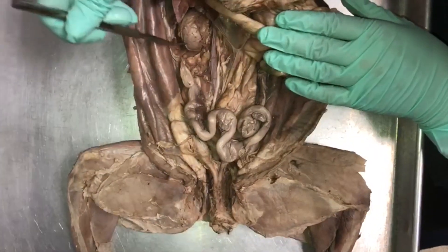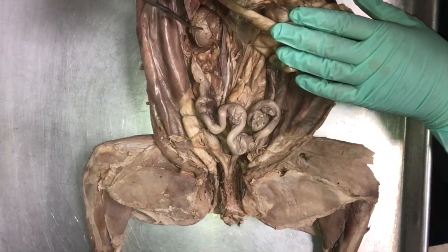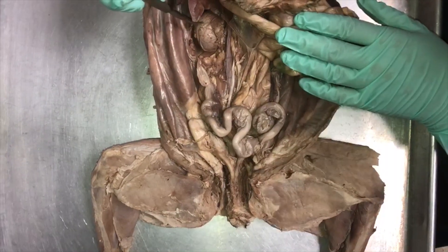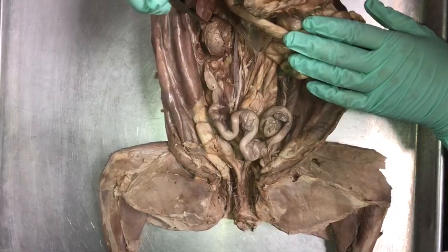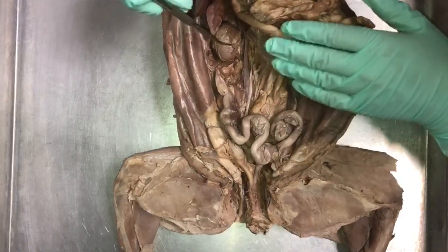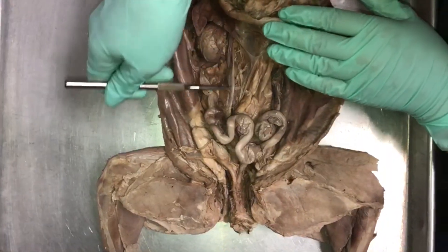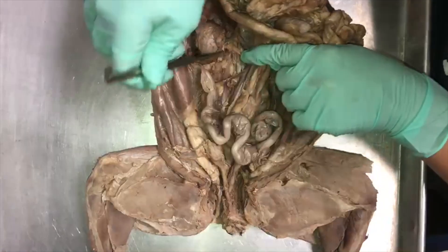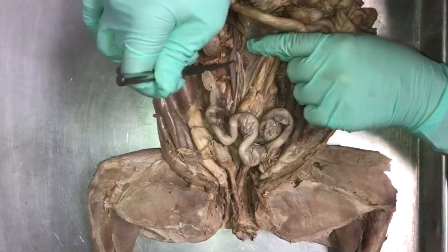Over here, you're going to have this round structure, which is going to be known as your kidney. Usually on top of the kidney, you're going to have glands known as your adrenal glands. But on this cat, they've been dissected out, so you're unable to see them. Going down from the kidney, you're going to have this cord here, which you can see is coming out of the kidney. And this is going to be known as your ureter.